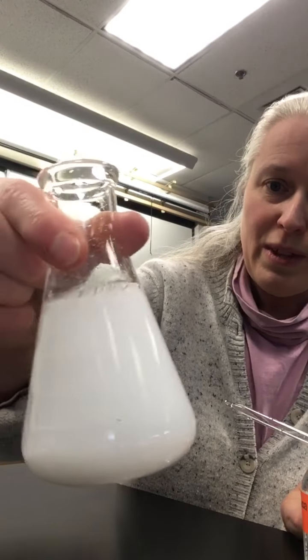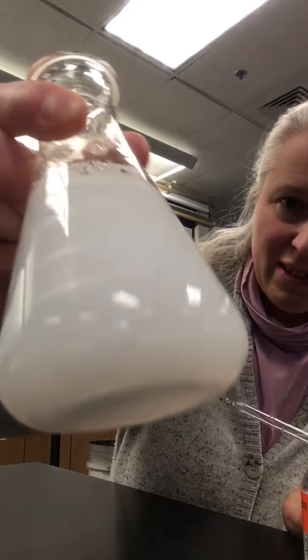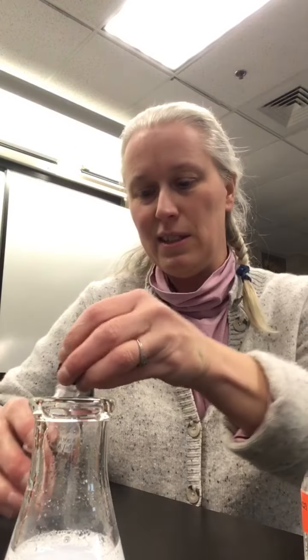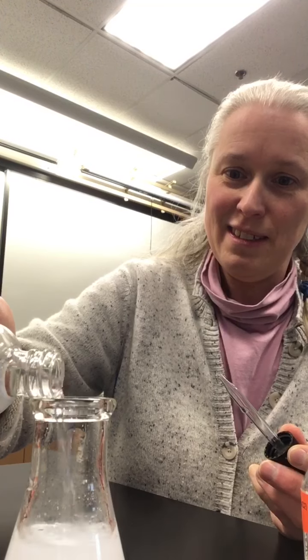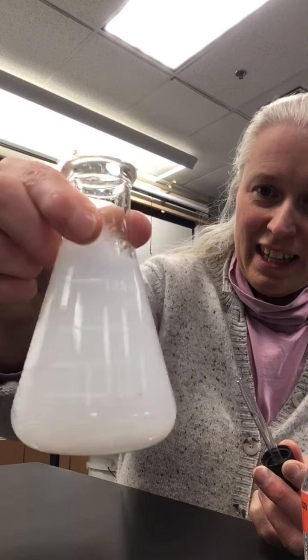And so what that means is that our milky solution, which actually has little chunks of solids kind of dropping out again, sort of that precipitate. Oh, maybe I mixed too much together. Just ran out of acid. Need some more acid. Add some more acid. Run out of room in my liquid. Is starting to get clearer, right?